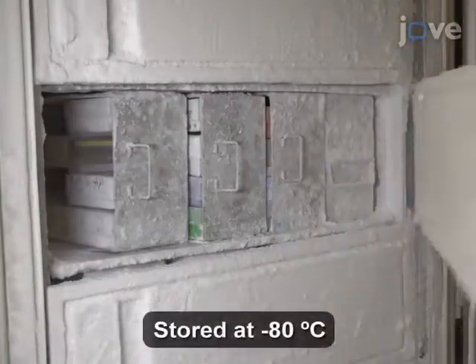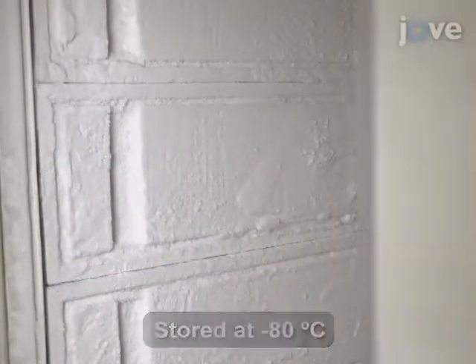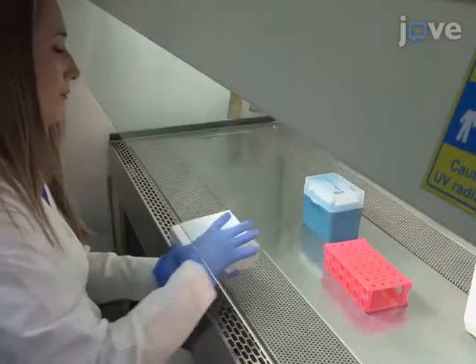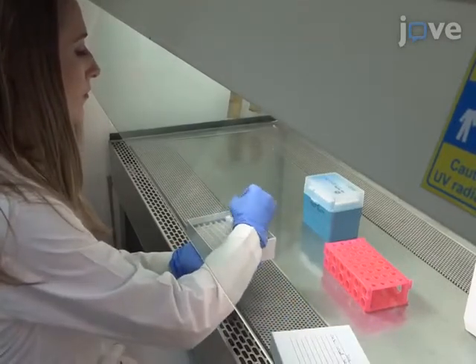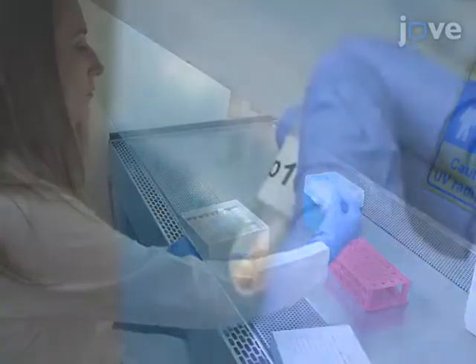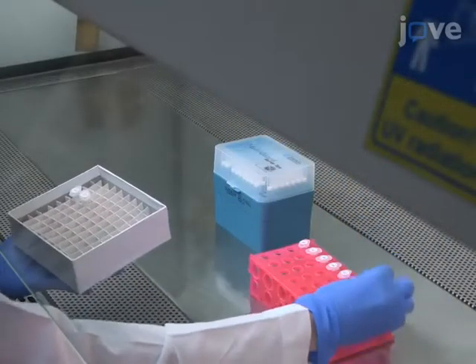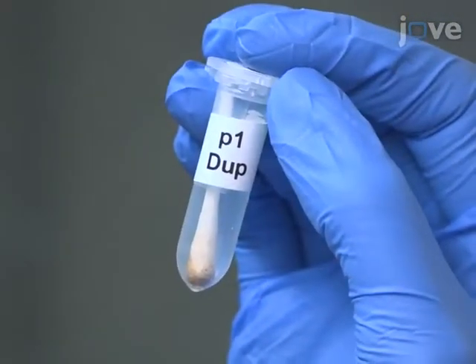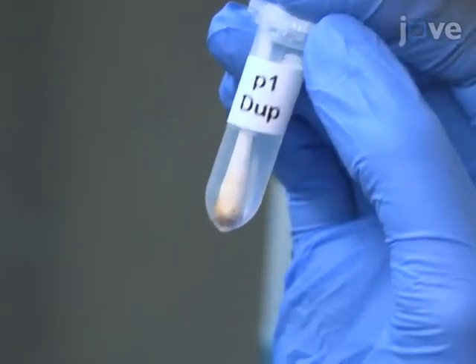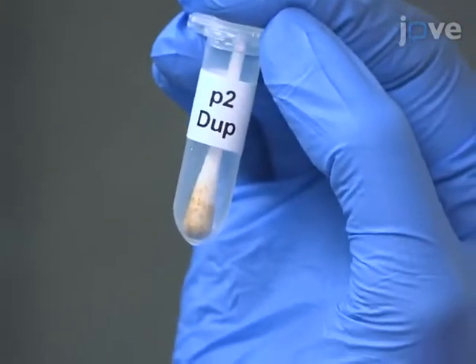For this protocol, have frozen feces samples that are roughly the size of a pencil eraser. The samples should be stored in 2mL tubes with the trimmed-off tip of the collection swab. Include negative controls consisting of swabs with no feces, as well as internal duplicate controls and sample duplicates from the original stool to serve as an internal control.